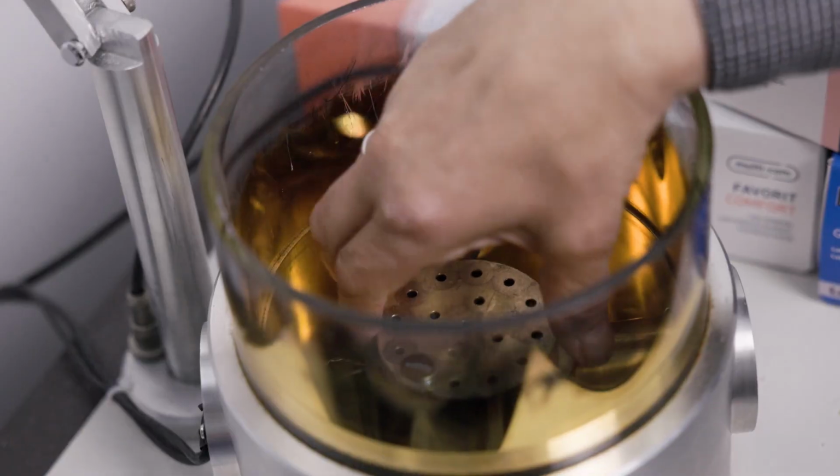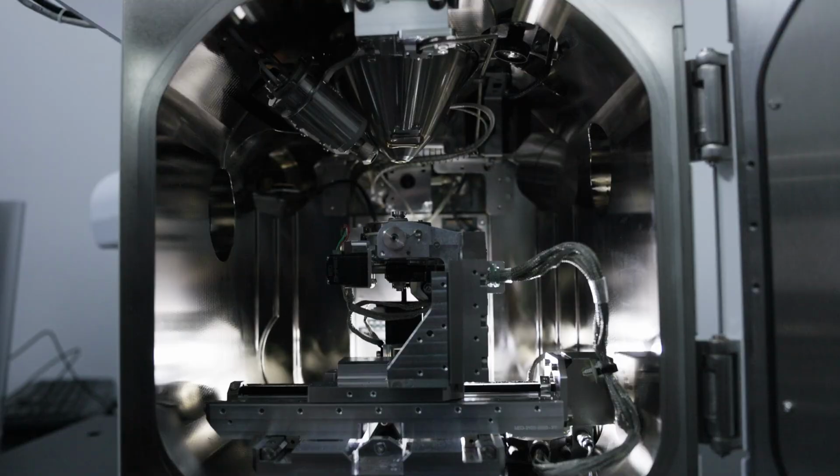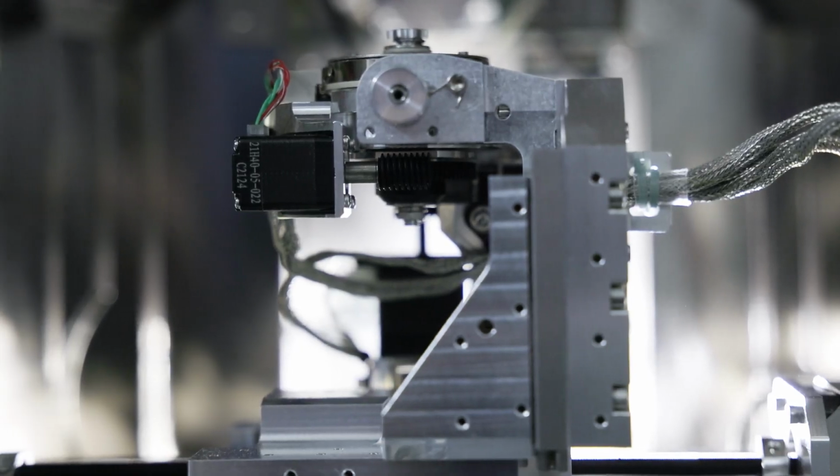I've been working with the technology and the software for about one and three-quarter years, I think. Formerly, we had two different computers and two different detector systems, two different devices for EDX analysis and SEM analysis. Now we have everything in one computer system. It makes the analysis easier. I started with 10 different materials 23 years ago containing asbestos. Now we are at about 230.